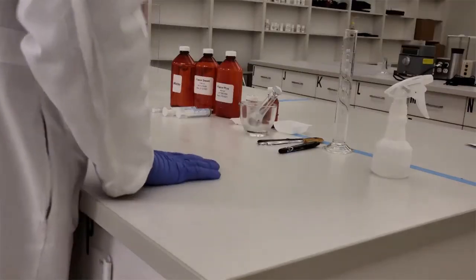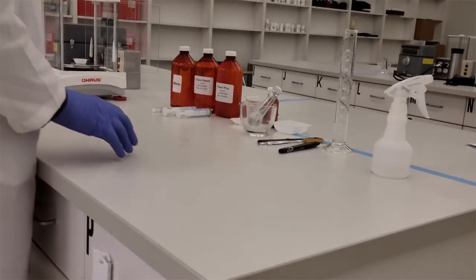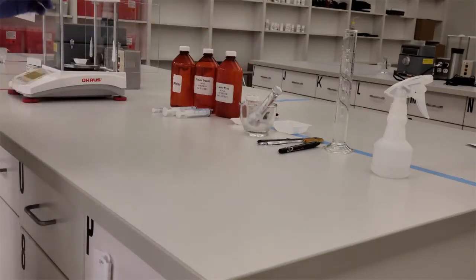I've cleaned my balance, and I've also cleaned my work surface, leveled my balance, and verified its calibration.